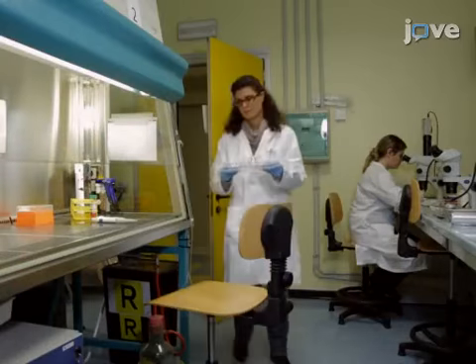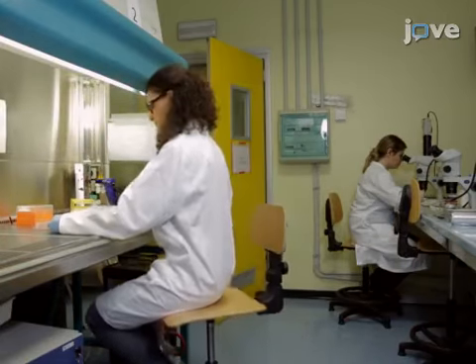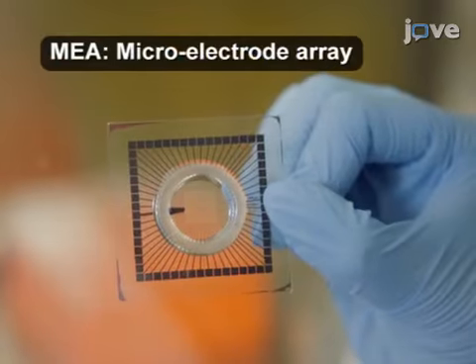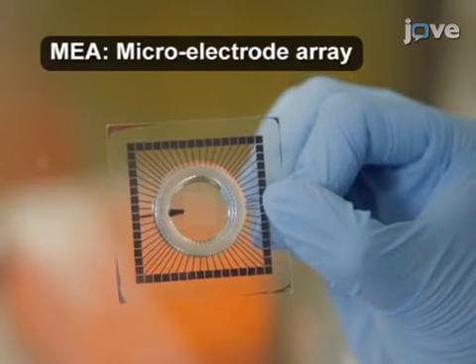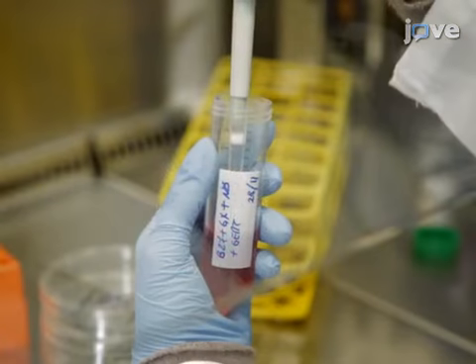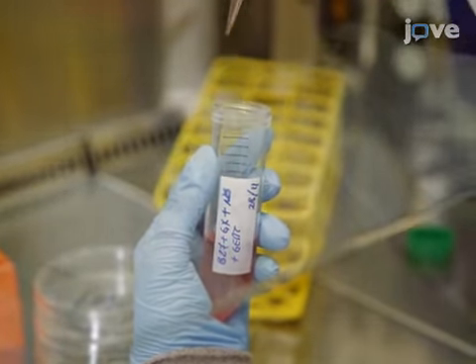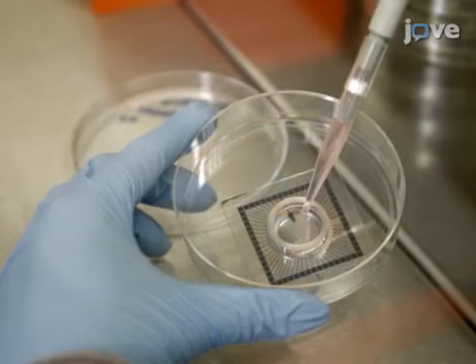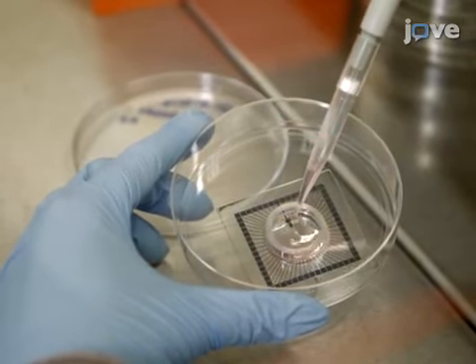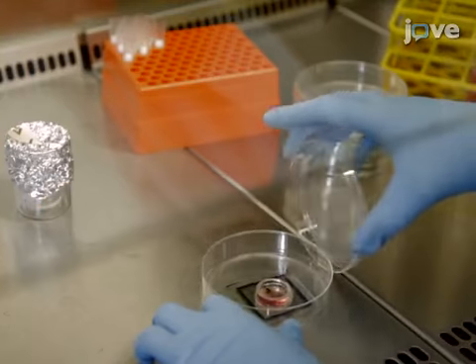The first step is to prepare a microelectrode array, or MEA chip, with 60 electrodes that can be used for stimulating or recording the neural network. After plating neuronal cultures on the MEA chips, wait about three weeks until the neural network has matured.